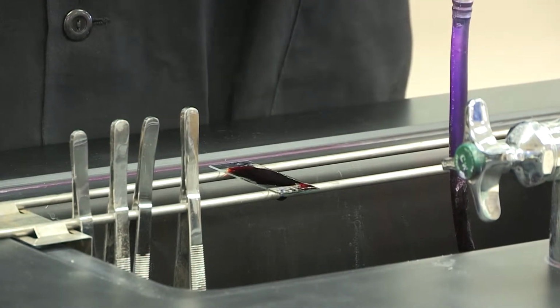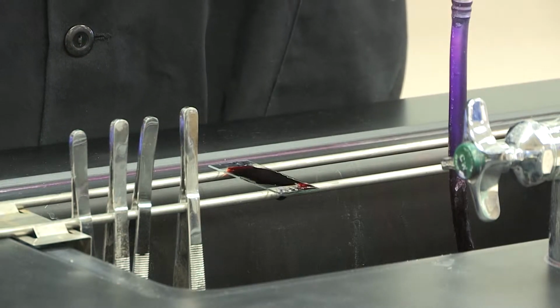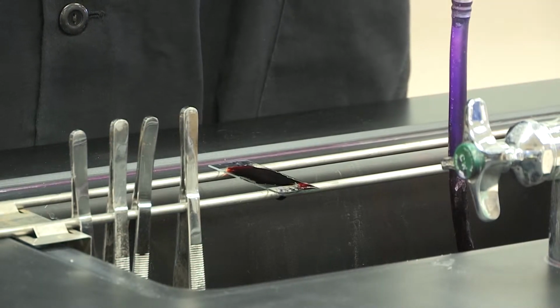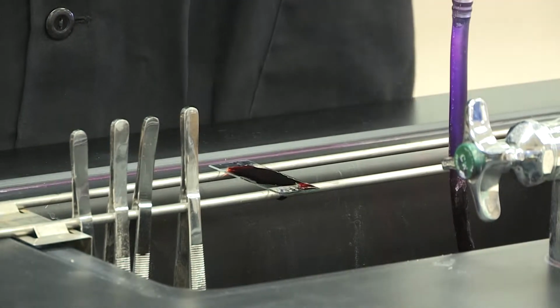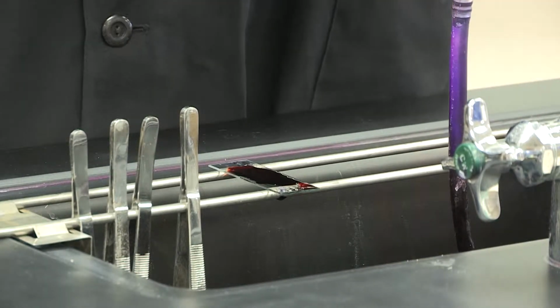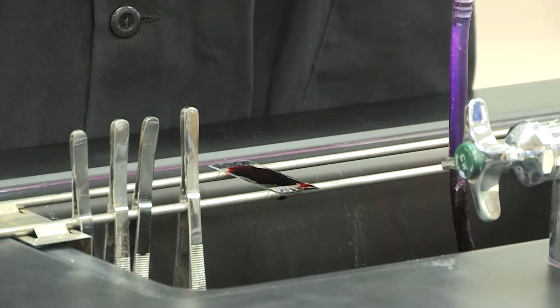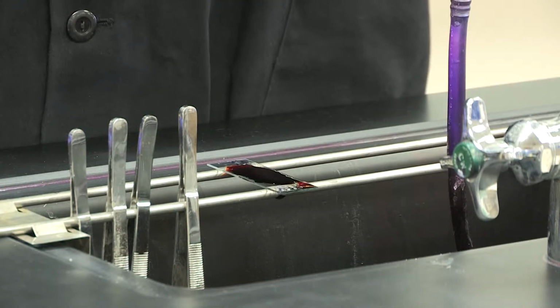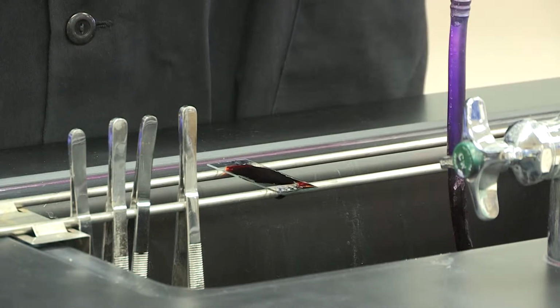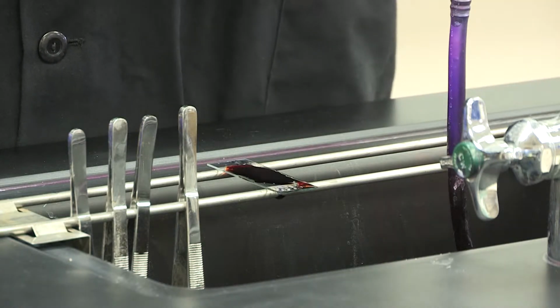If you did not do this step, the dyes would simply wash out every time you rinse them. And so this is a very important step to make sure that you follow. Now this is the first step that you can also mess up, because if you leave this on too long, it will actually turn the color of the iodine, which is kind of a rusty color. And so that's not going to be very good to see under the microscope because you will not be able to tell if it's gram-positive or gram-negative.